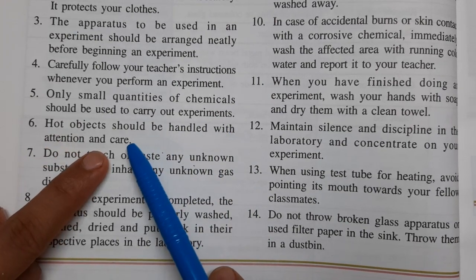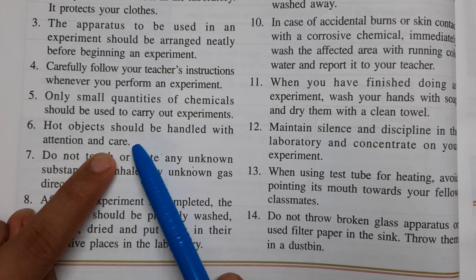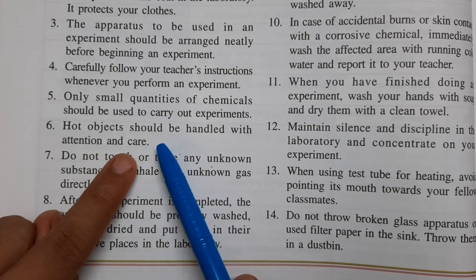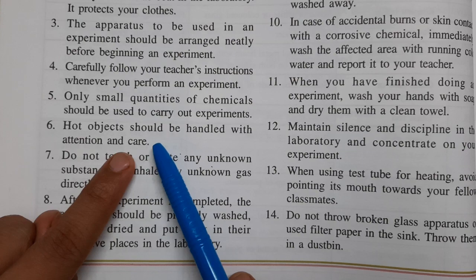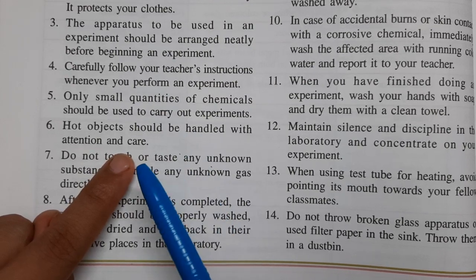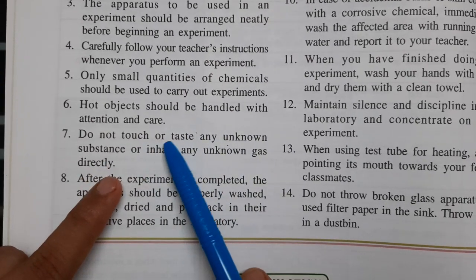Sixth: hot objects should be handled with attention and care. Some chemical reactions require heat from a Bunsen burner. When we heat a chemical reaction, we need to take care and pay attention. That is why whenever the teacher gives you instructions, you need to listen carefully and then carry out the experiment carefully.